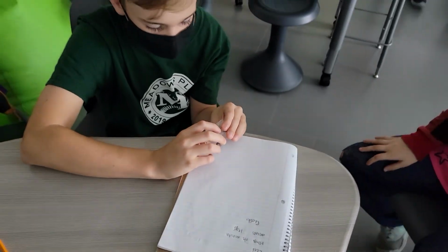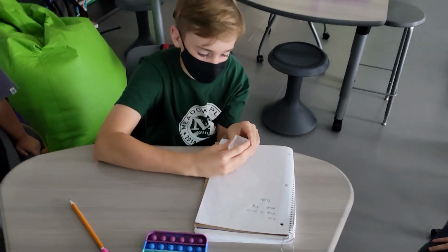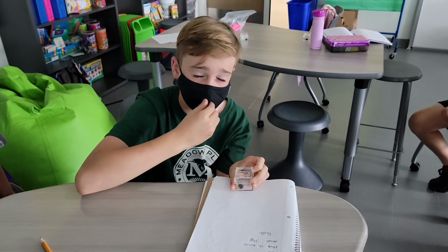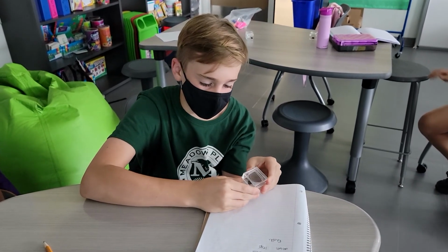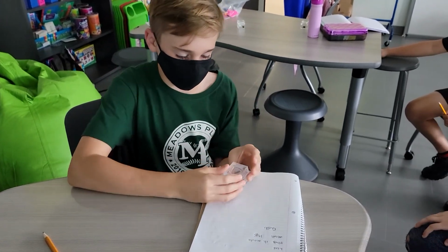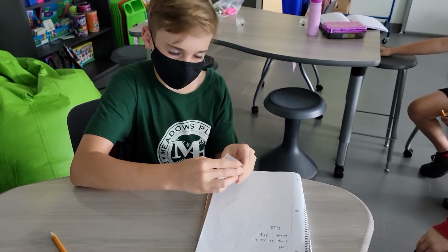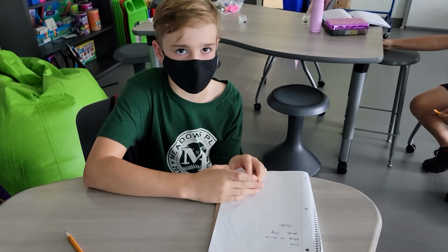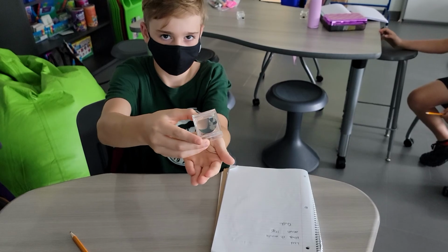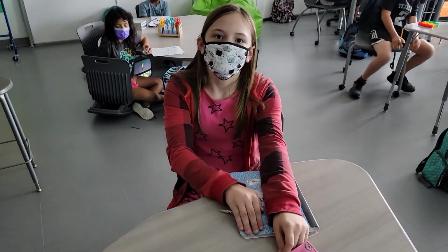Okay. Now, my friend right here, what is something else that you have noticed with your observation? I have noticed, and we've learned this in previous days, that they have this kind of armor, I'd like to say, called an exoskeleton. Correct. It basically will protect them as they fight for food and other valuable resources, I would say. Okay, so they need that protection in order to help them survive, correct? Correct.